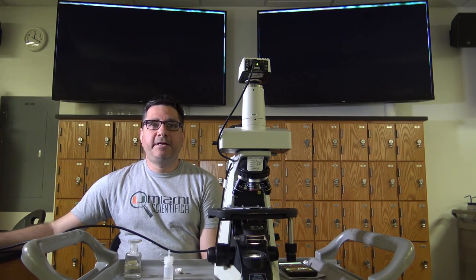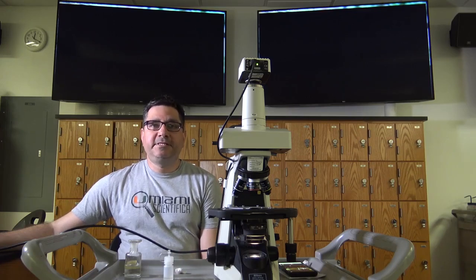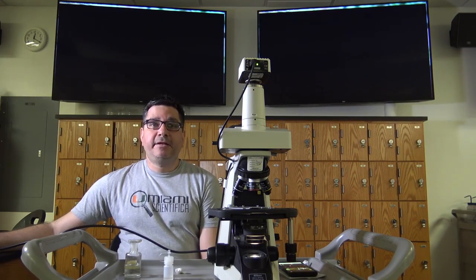Before you attempt to use your microscope, at the beginning of the exercise, make sure of the following. The microscope does not have any damage from the previous group. If there is, report this to your TAs or me. That the objectives, light source, and eyepieces are clear of obstructions and are clean. If they are not clean, please clean them before you attempt to use the microscope. Use the lens paper and ethanol to clean the scope.